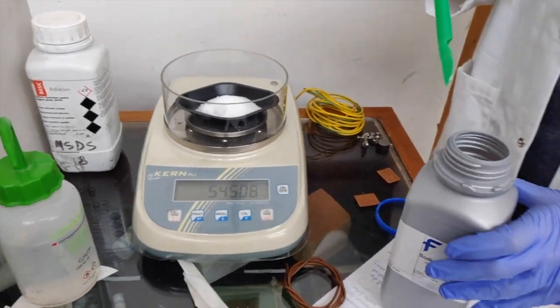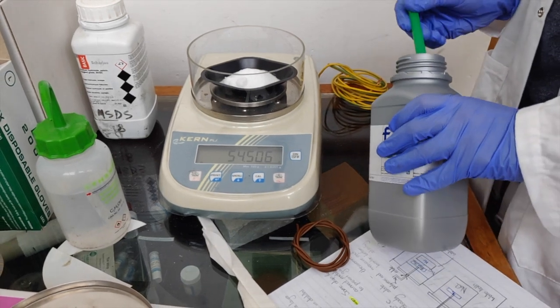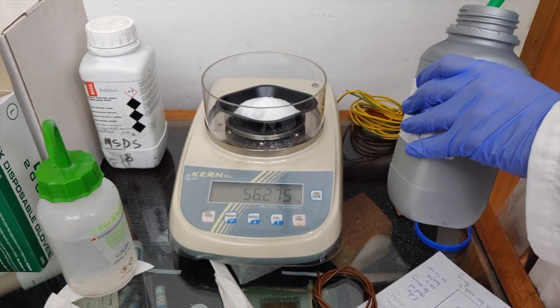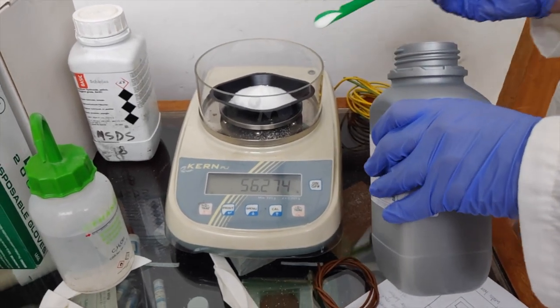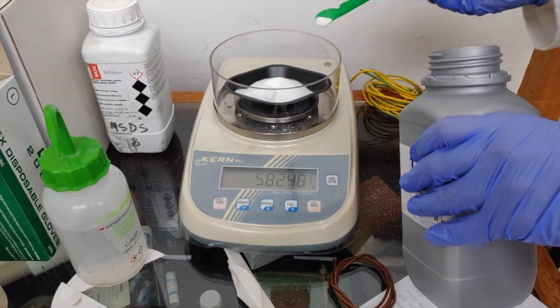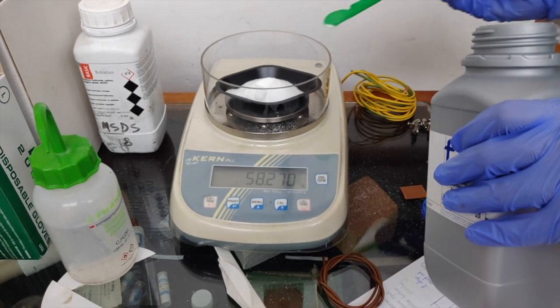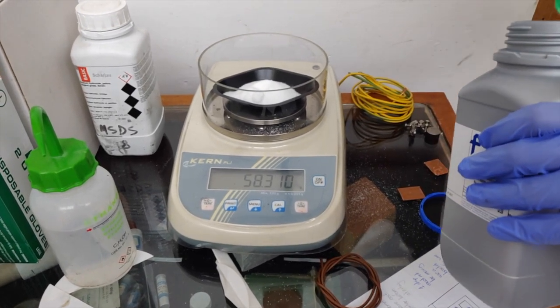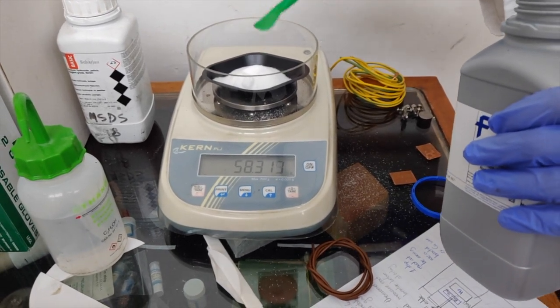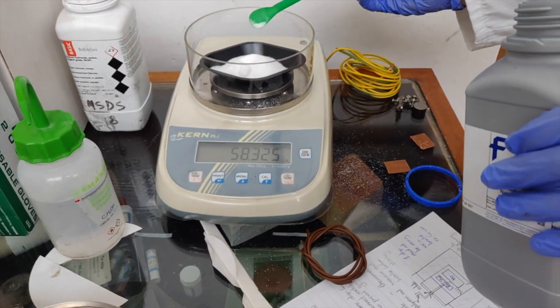Cleanliness is a very important factor in this experiment. All components were handled with rubber gloves, and the solution was never met with bare hands or other solutes. Thorough cleansing of the main components was necessary before setting up the apparatus. These components included two identical copper electrodes, two electrolyte containers, a thermometer, a stirrer, and all the necessary beakers. The experiment setup was prepared and the electrodes and stirrer were rinsed with the electrolyte before being set in position.